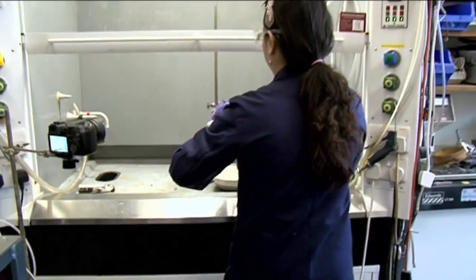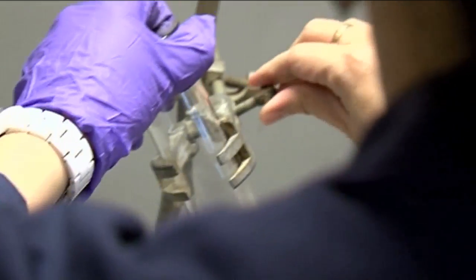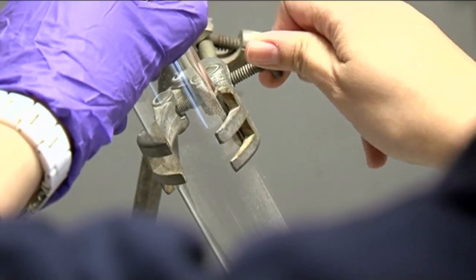Okay, for this one, we're just going to be extra safe, extra cautious. So we're going to actually put a blast screen around it and then lower the fume hood as well.